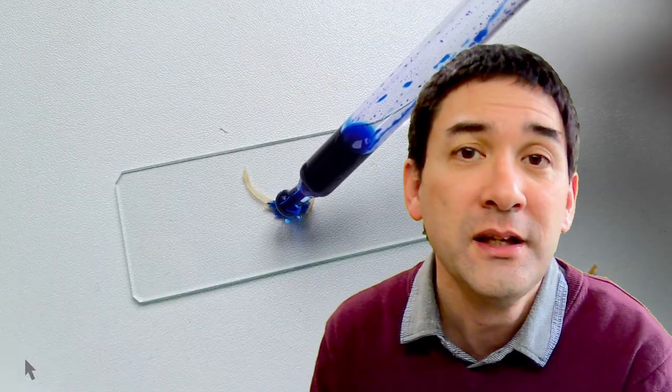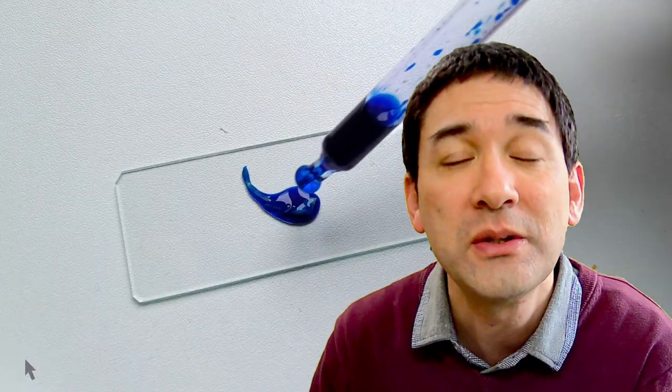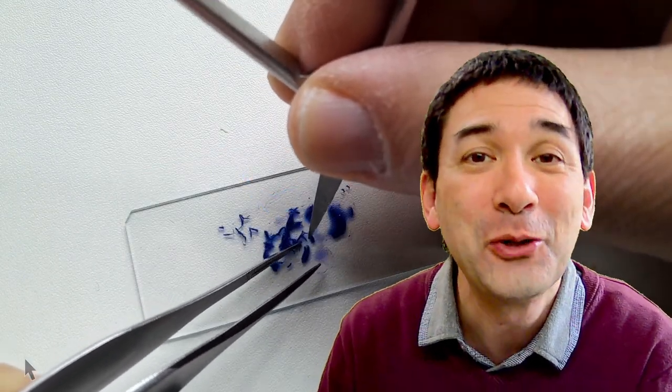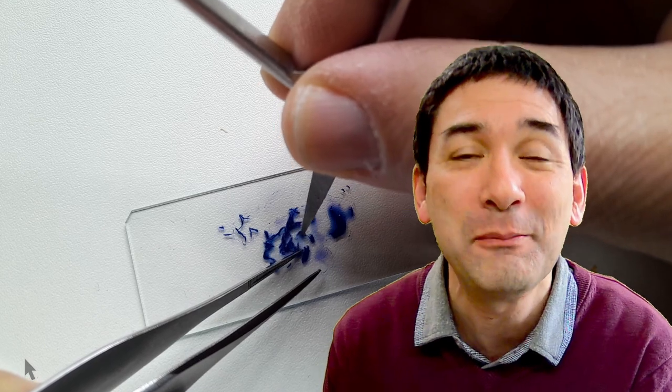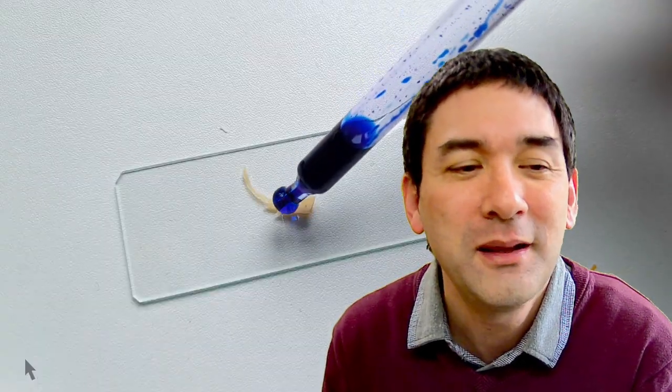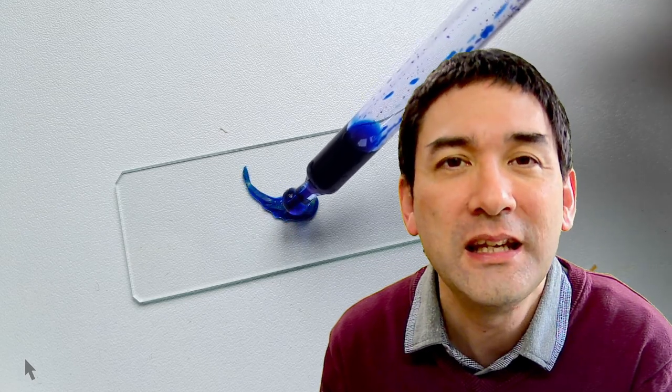I also tried to make the structures more visible using methylene blue staining, but it did not make a lot of difference — that's a step you don't have to do, but I wanted to share it. The blue is a little more colorful and makes it appear nicer, but in reality we do not see the structures much better. So it's an obsolete step, though methylene blue is a very popular staining method.